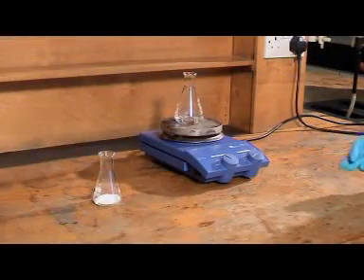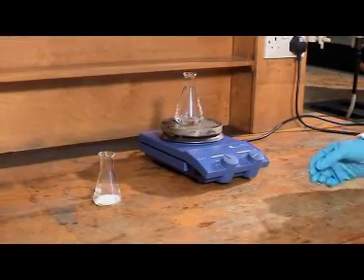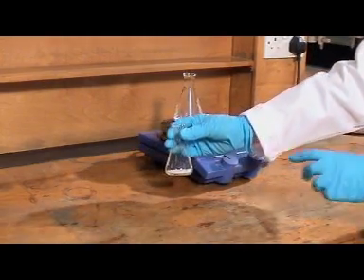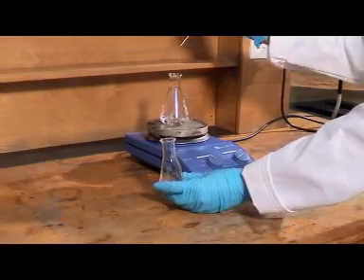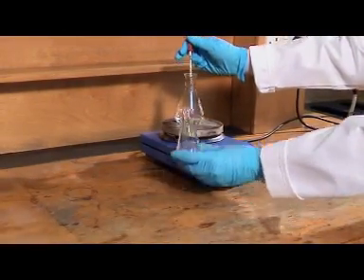One of the key things in a recrystallization is ensuring that the minimum amount of hot solvent is used. So we're going to add the hot solvent dropwise to the solid.